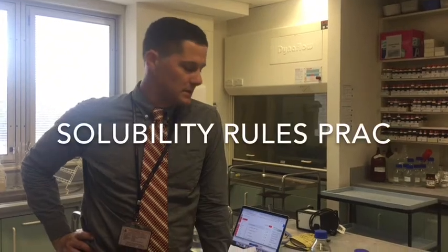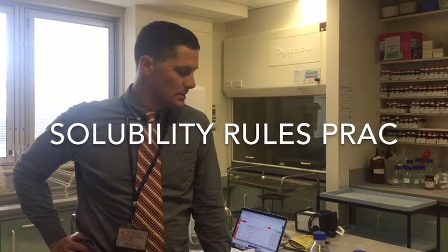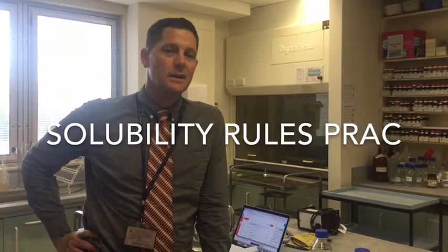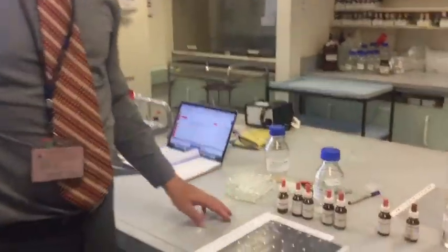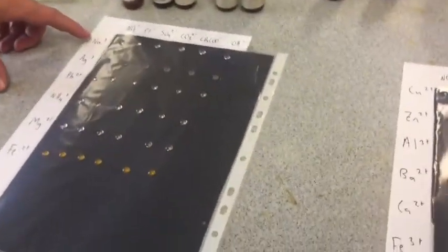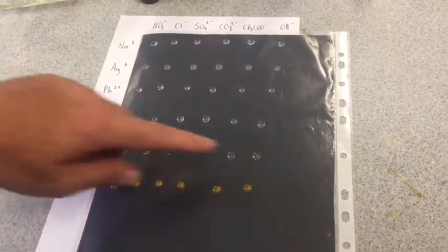So this prac investigates trying to figure out the solubility rules. We put combinations of anions and cations together, and where we see precipitates, we can then determine solubility rules. If we have a look at the first sheet here, we've set it up with metals going across, so there's iron, 2+ ions in all of these, etc.